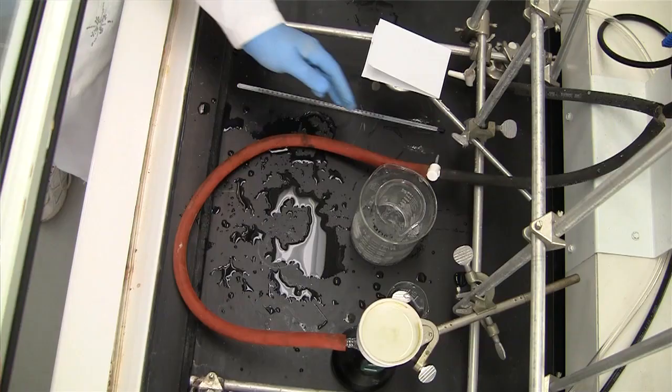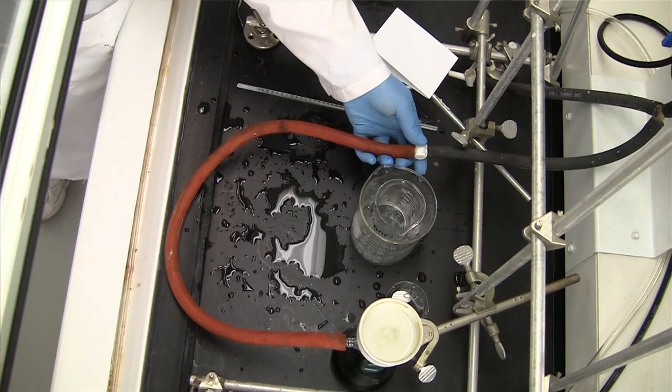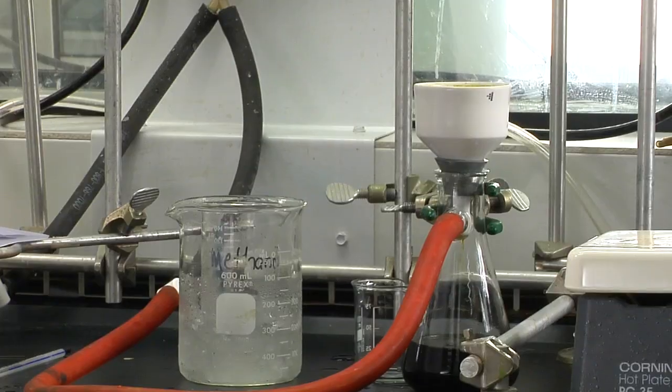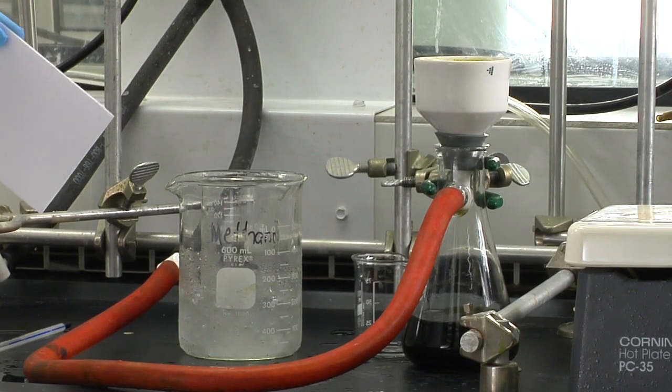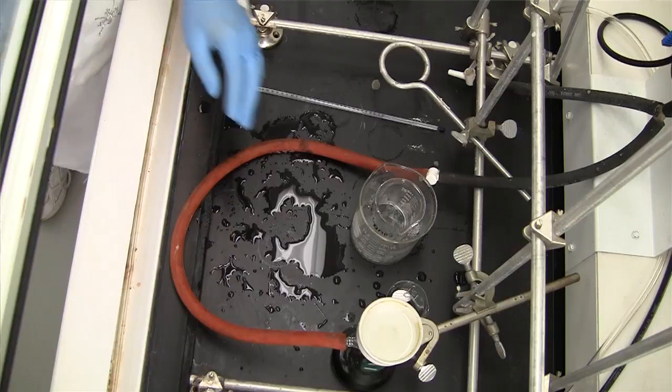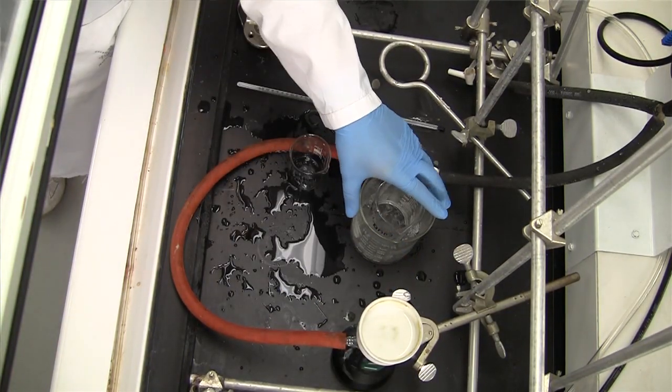After letting it stand, you can release the suction. Continue to wash with methanol until the filtrate is clear.